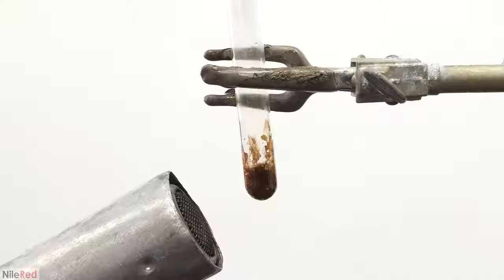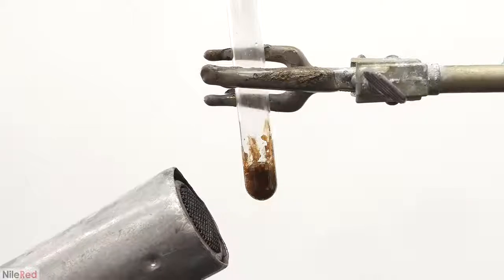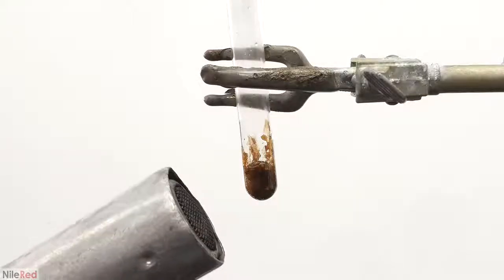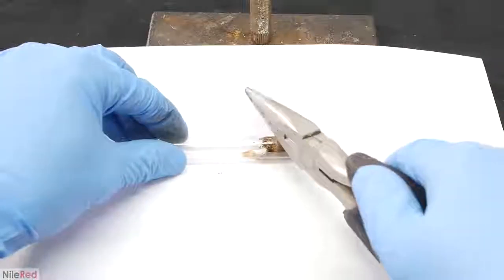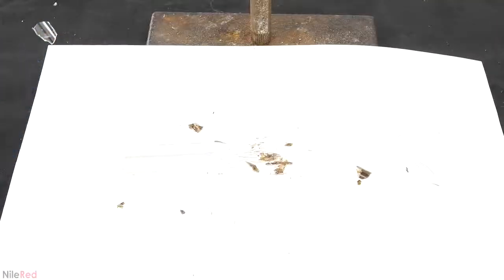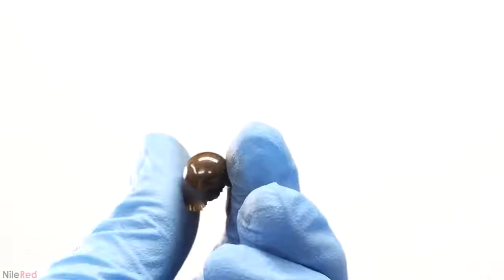You'll notice here that there's some bubbling going on, and these are impurities that are boiling off. The major impurity is hexamethylene diamine, which boils around 205 C. The boiling eventually dies down a lot, and I decided that I was pretty much done. I allowed it to cool, and to get out the nylon, I smashed the test tube, which kind of exploded. I found the end piece that flew away, and this is the nylon that I got.